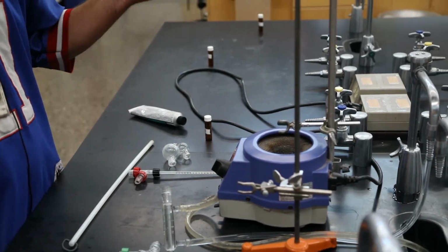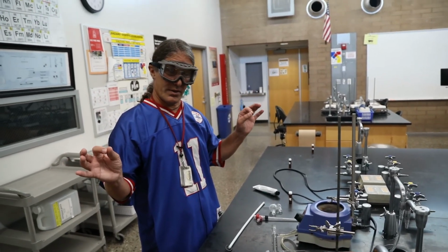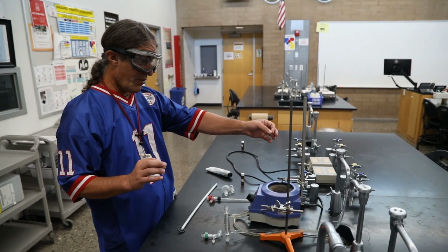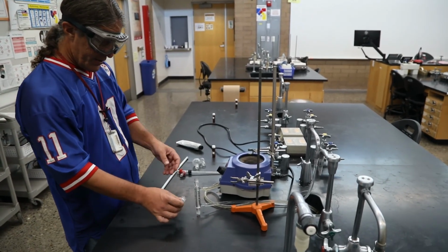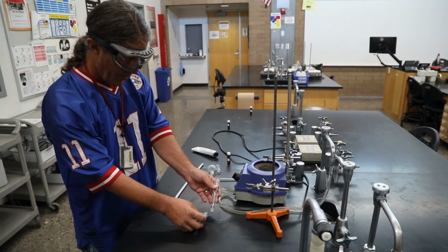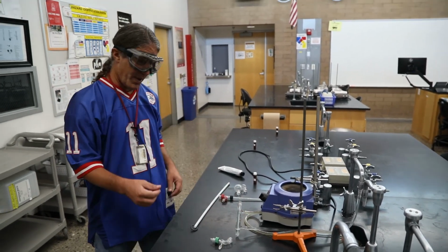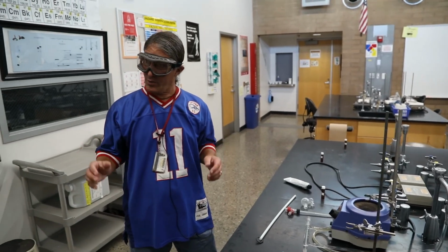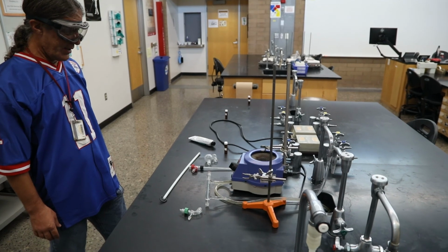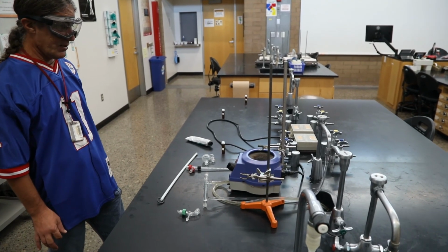All right, so that's our distillation. It looks like it went super smoothly. We had a couple little things. The water tried to shut itself off. We had to turn it back on. This joint separated at one point when I was assembling the apparatus, but I noticed that and put it back on. So it went super smooth, and I'm pretty happy. Quick and easy, and everything distilled at one temperature.